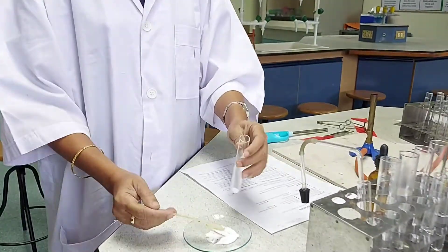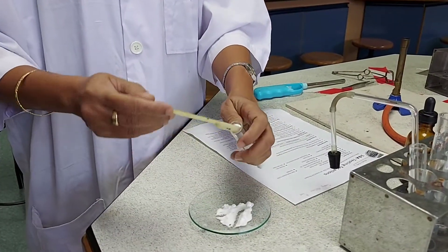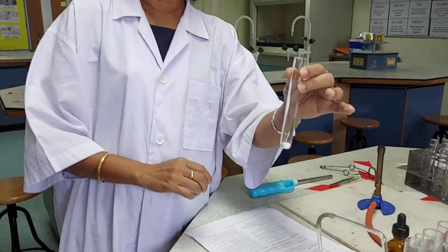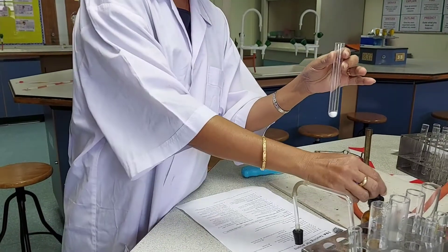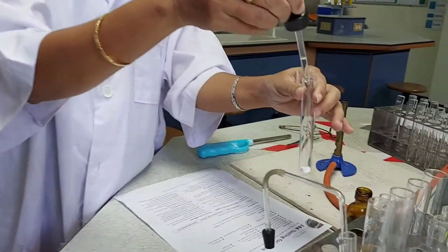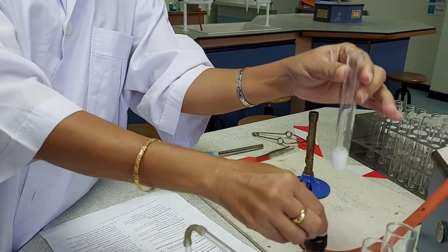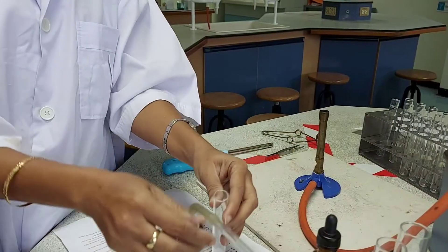I am taking a carbonate salt, and I have to test for the presence of the carbonate ion. So to this salt I will add dilute hydrochloric acid. You can see the brisk effervescence, which is a clear indication of a gas being evolved.